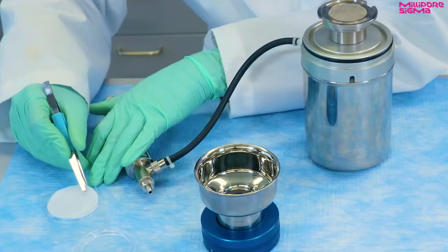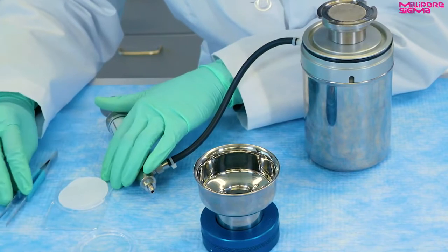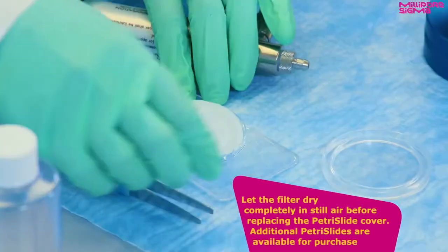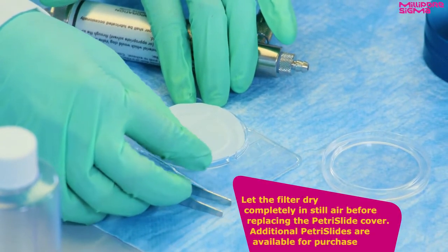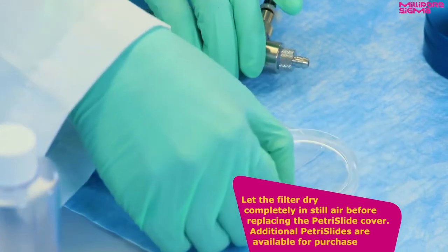Remove the test filter with forceps and place it face-up in a Petri slide device. Let the filter dry completely in still air before replacing the Petri slide cover. Additional Petri slides are available for purchase.